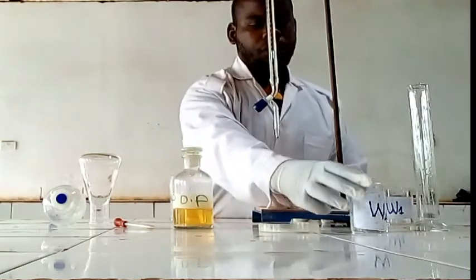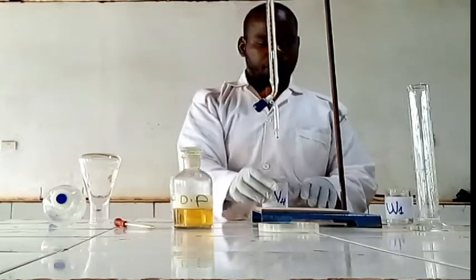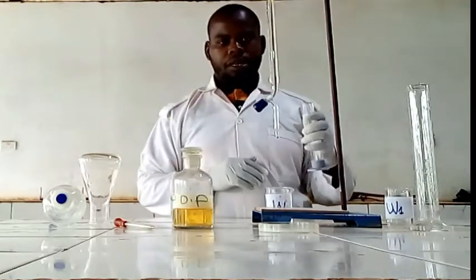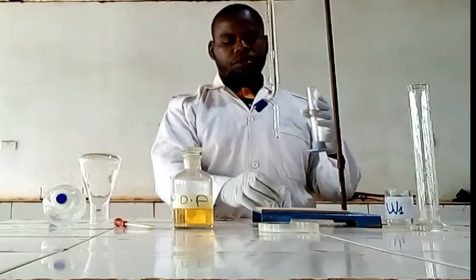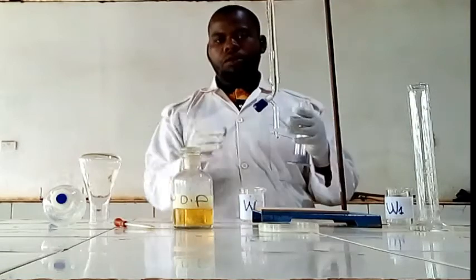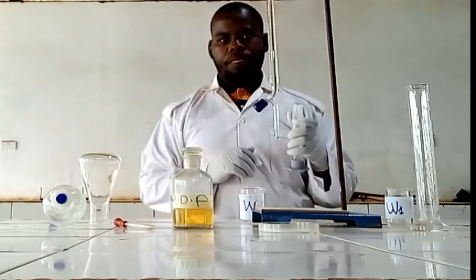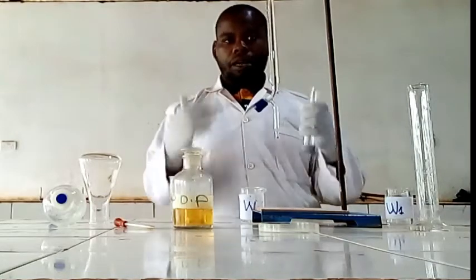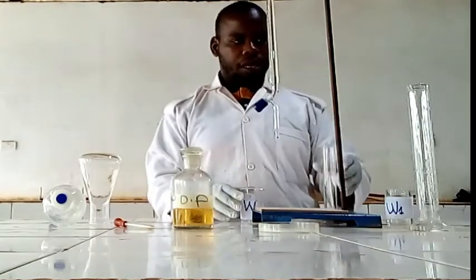According to the question, we have to measure 100, but in the procedure we are going to use 50. Or if it will be enough, 100, we are going to use 100.